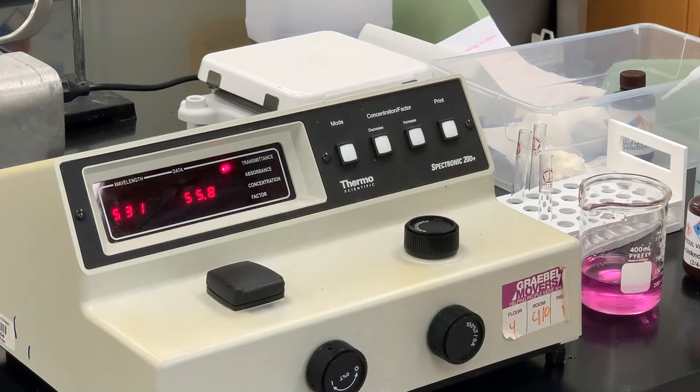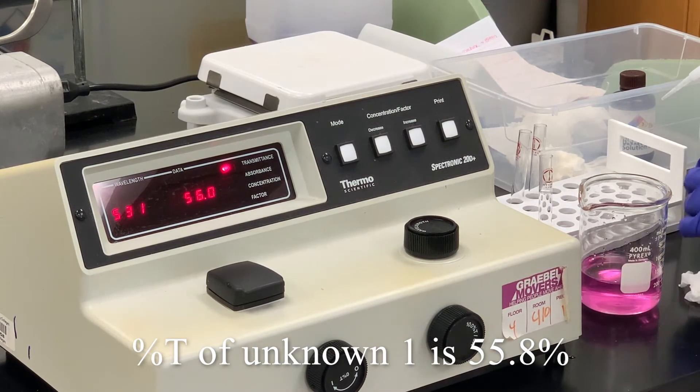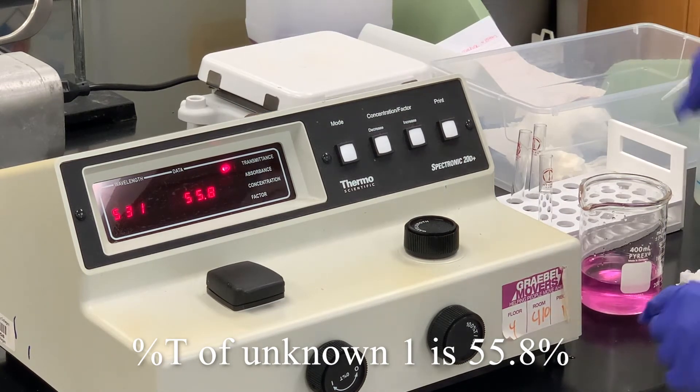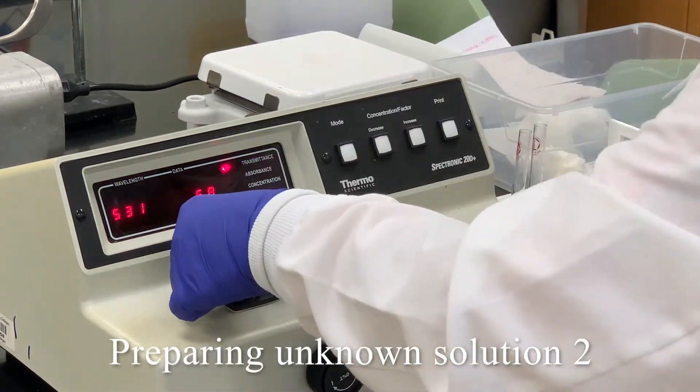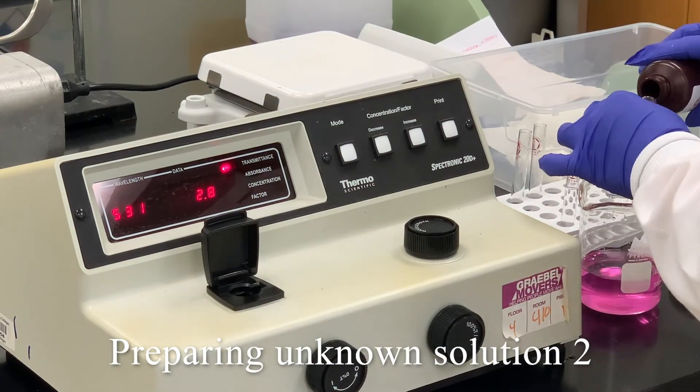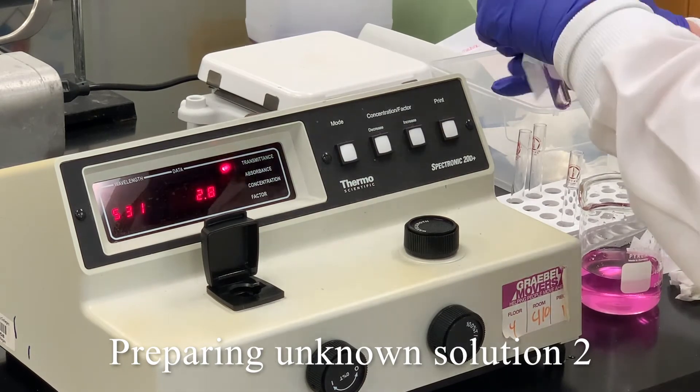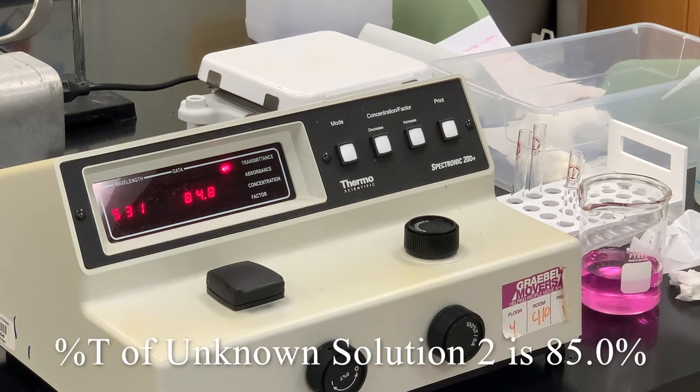And for solution unknown one, I've got 55.8. And unknown two is 85.0.